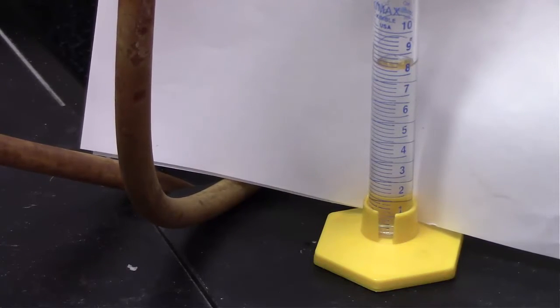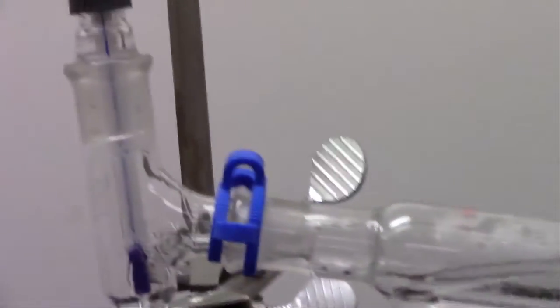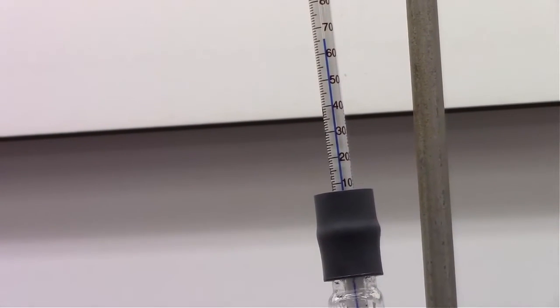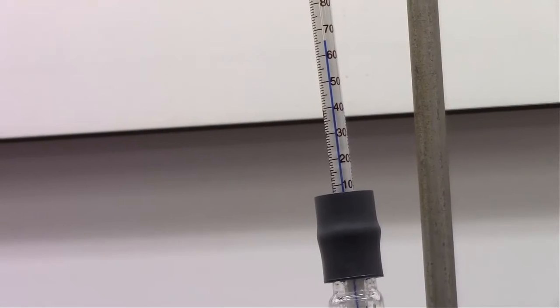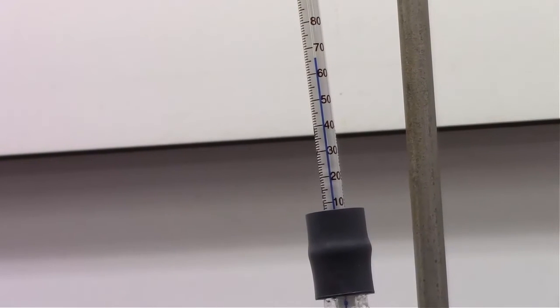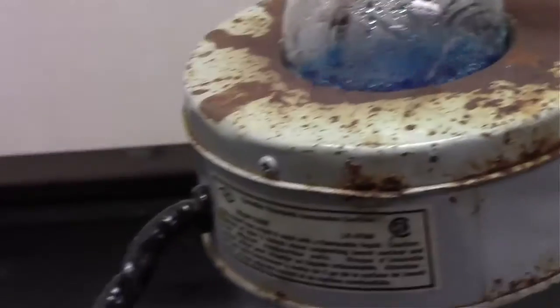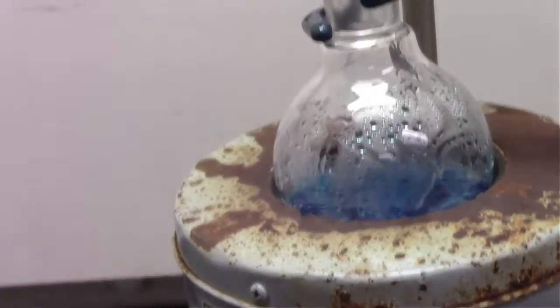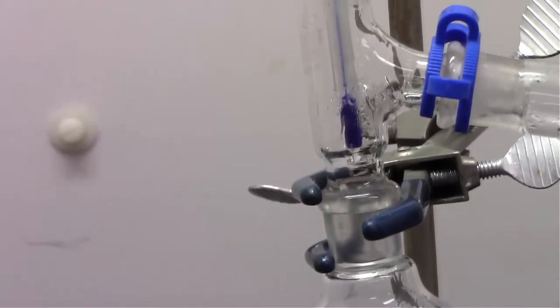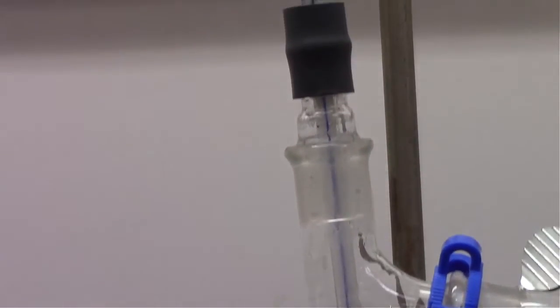And as we're collecting, now we're up at 65 degrees Celsius, so we definitely do not have pure acetone being collected at this point. And really, when I said about 58, that's still slightly higher than the boiling point of acetone. So the purity level of even the first three or four milliliters collected probably wasn't 100%, meaning that acetone is carrying over some water with it as it's being collected at the beginning, and now it's definitely carrying a small amount of water over with it as it's being collected.